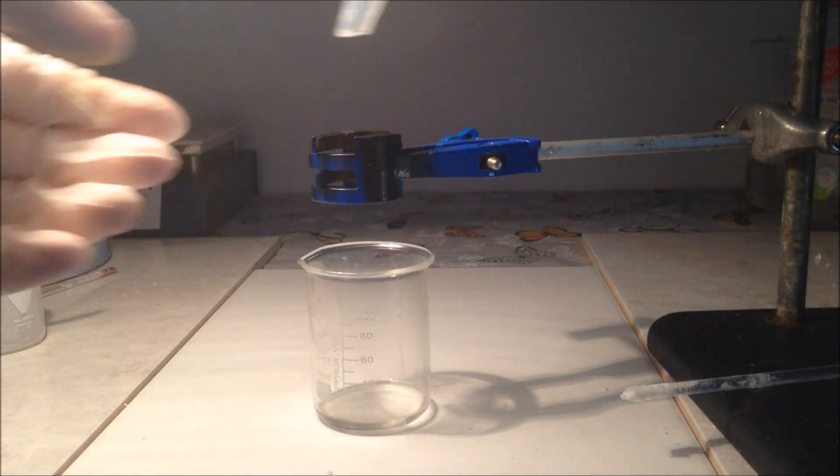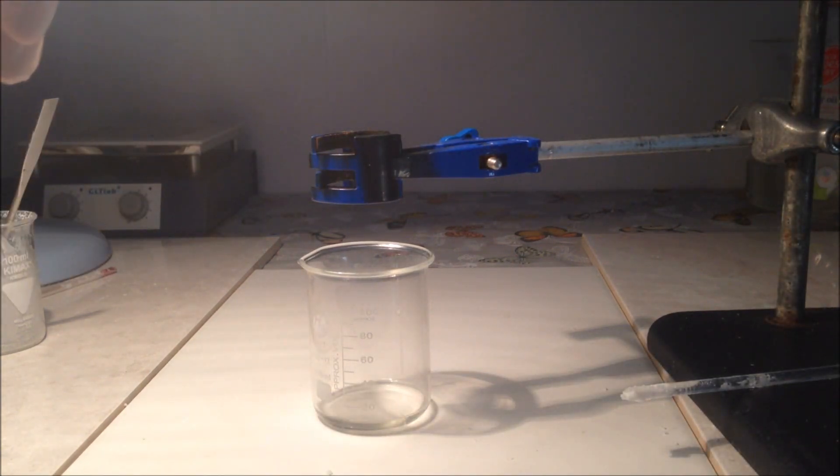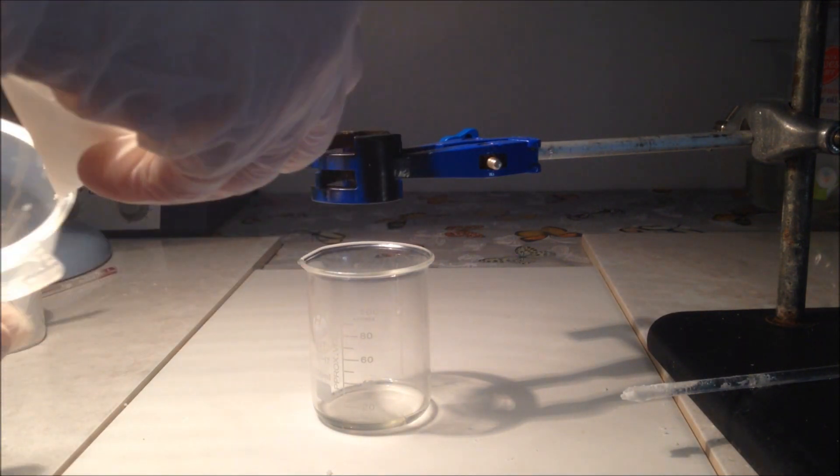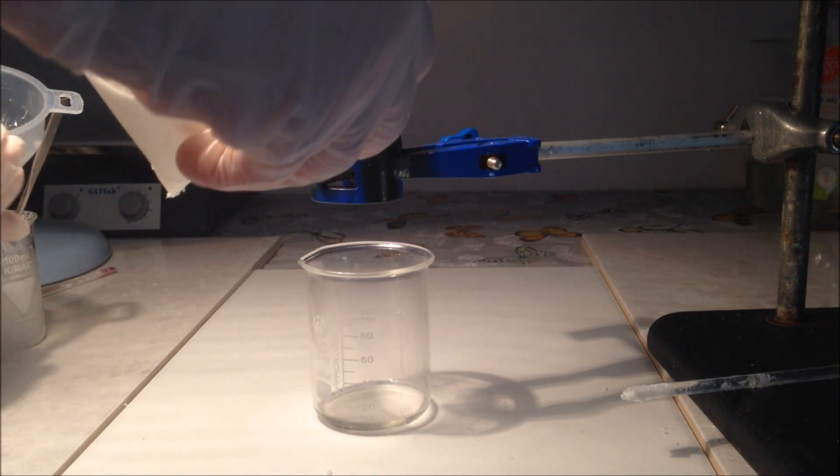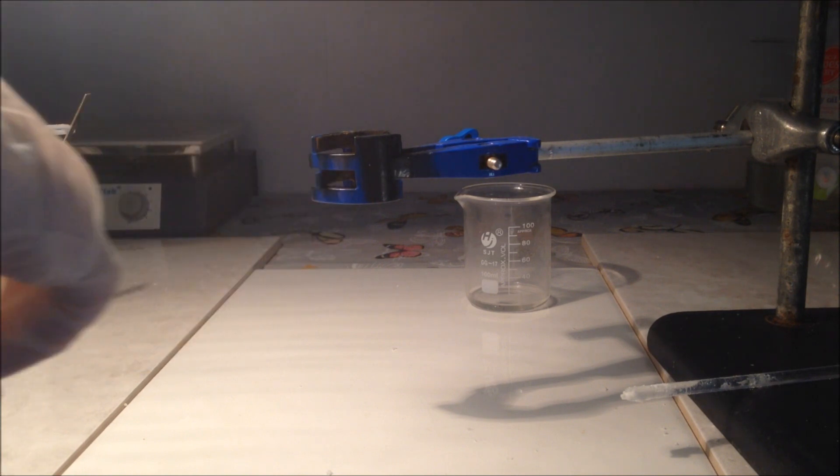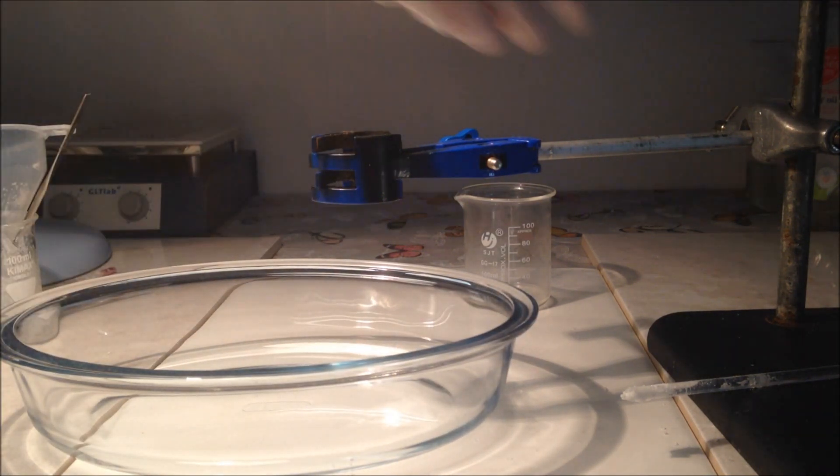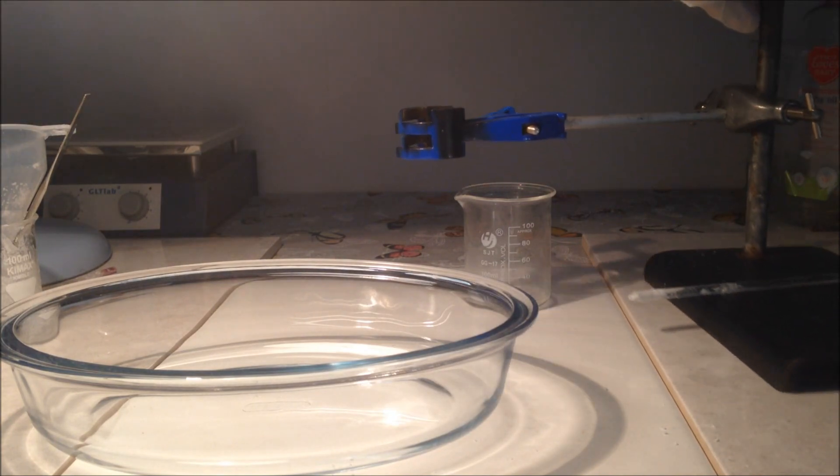I added two portions of 5ml of acetone just to dry. You probably should add some cold water to help get rid of any impurities, but I didn't end up doing that. The acetone is just to remove any water to dry quickly.